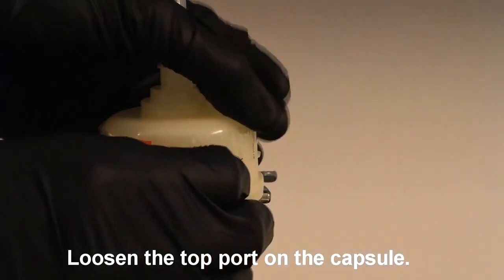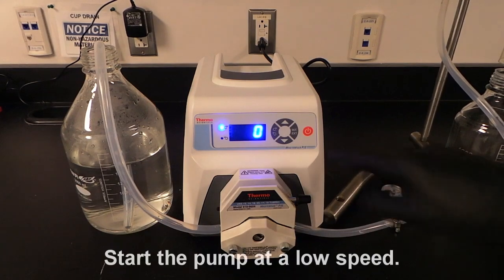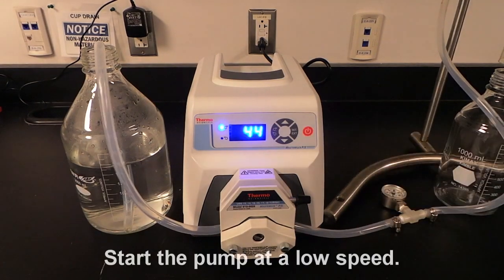Loosen the top port on the capsule, and then start your pump at a low speed.